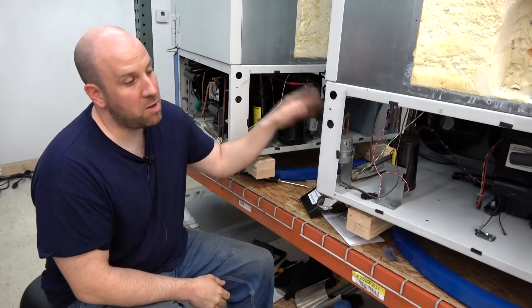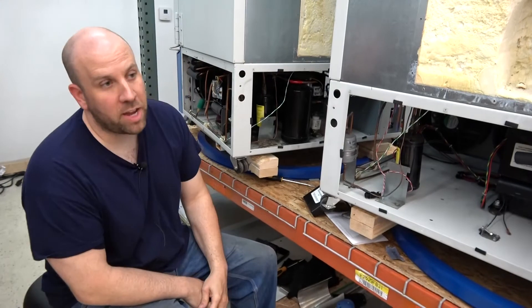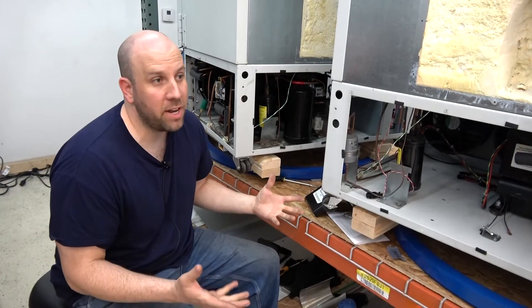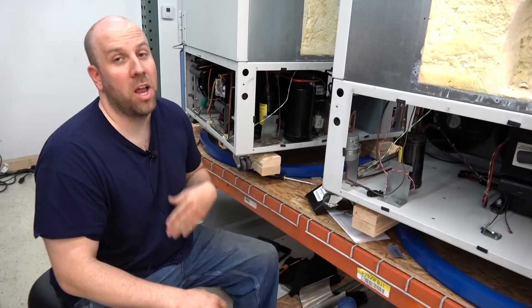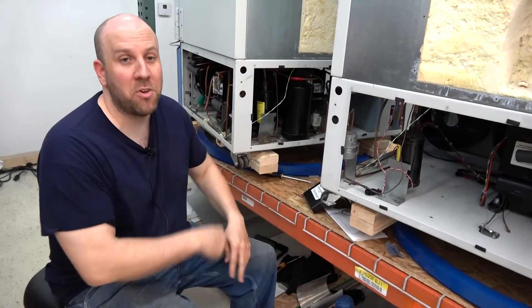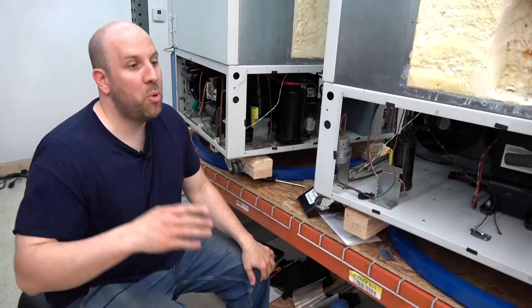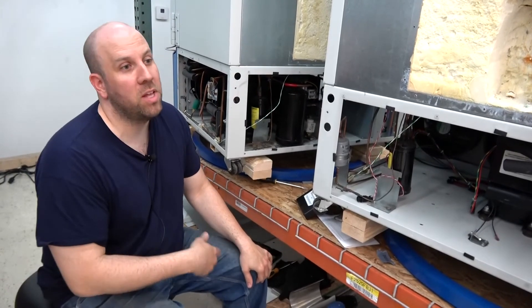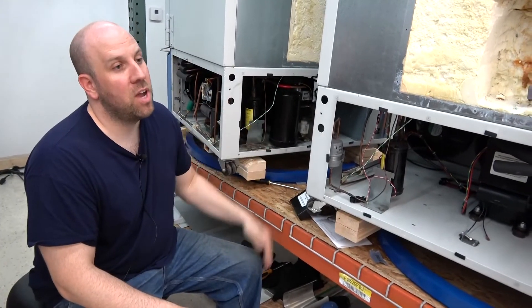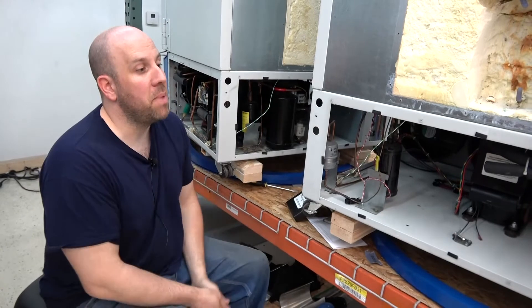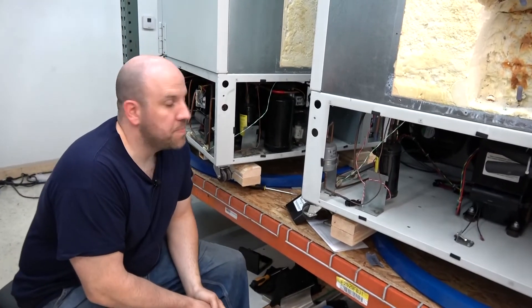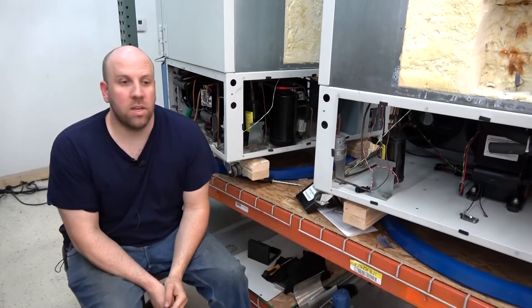So I think we found instead of messing around trying to evacuate and recharge, we can't get it to perform any better. So we're just going to take it apart, flush it out, get every single last contaminant we can out of the system, put in new filters, oil separator, all that stuff and try it out and see how it works. And it's been amazing. That's pretty much our process.